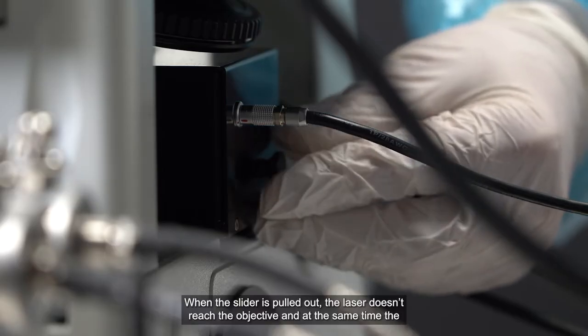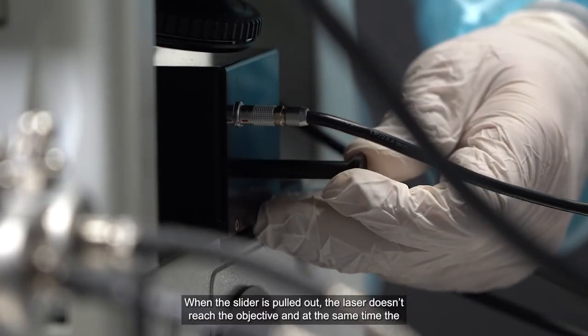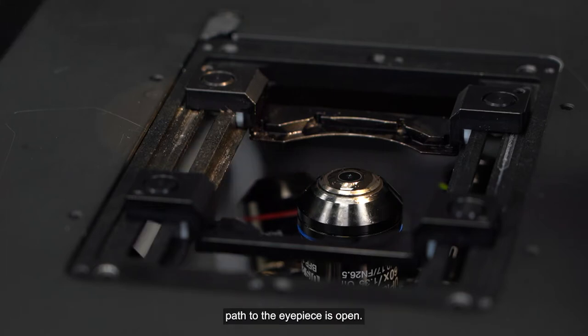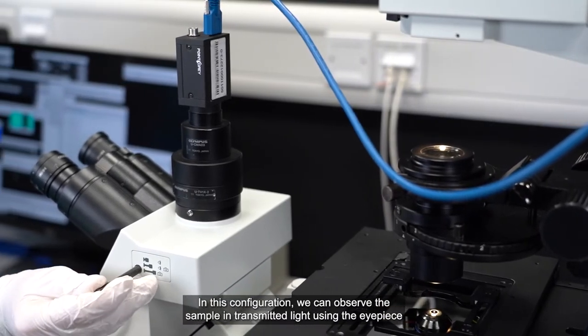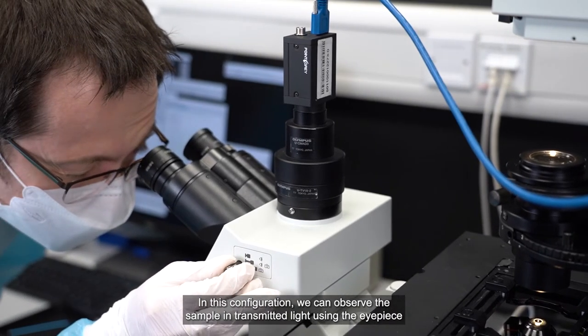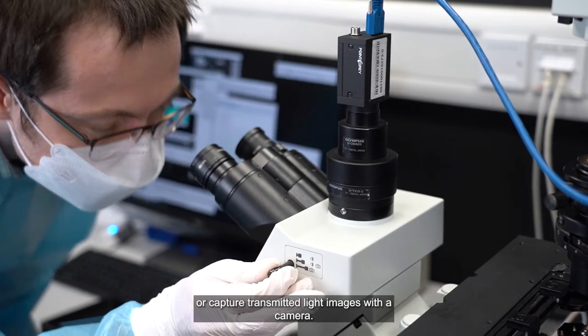When the slider is pulled out, the laser doesn't reach the objective and at the same time the path to the eyepiece is open. In this configuration, we can observe the sample in transmitted light using the eyepiece or capture transmitted light images with a camera.